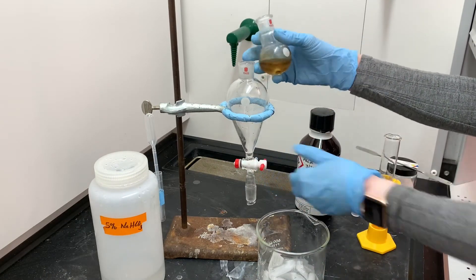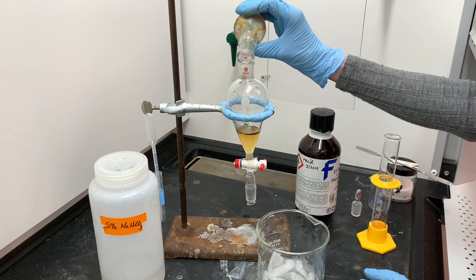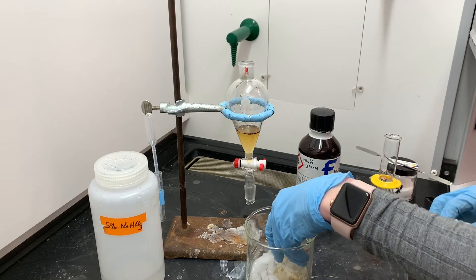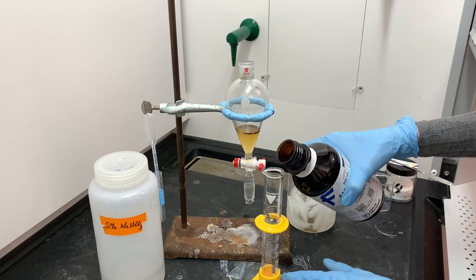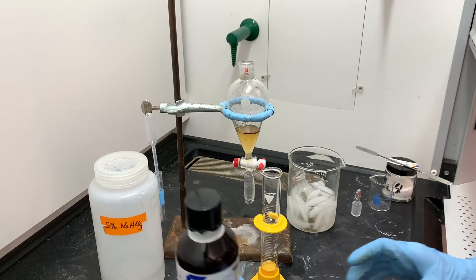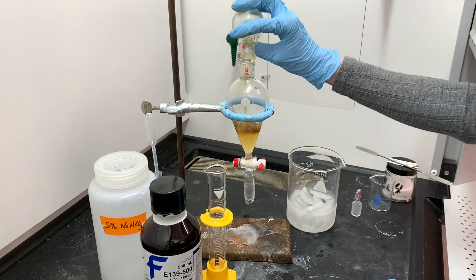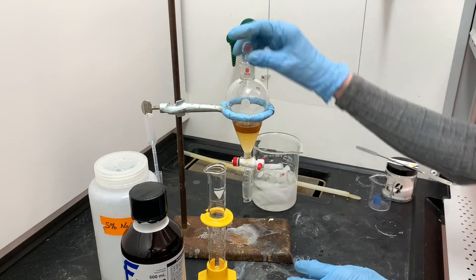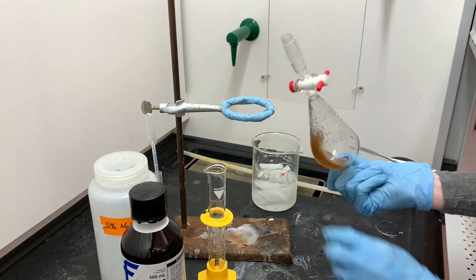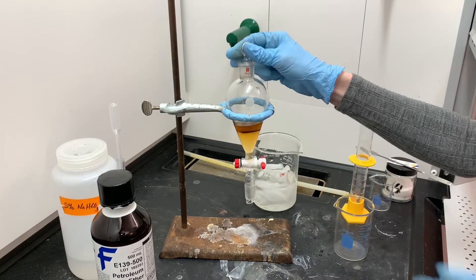I'm going to pour everything out of the round-bottom flask into the separatory funnel. It's a nice amber, yellowish-brown color. I'll get a little bit of petroleum ether for the first extraction, and to make sure I'm getting everything transferred, I'll pour the petroleum ether into the round-bottom flask, swirl it around, and then transfer it into the separatory funnel. Now that the petroleum ether is in there, you can really easily see the two layers. The top layer contains our product and petroleum ether. Shaking this up gets our product to move into the top petroleum ether layer.